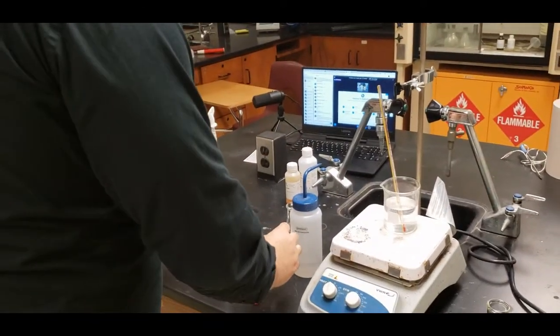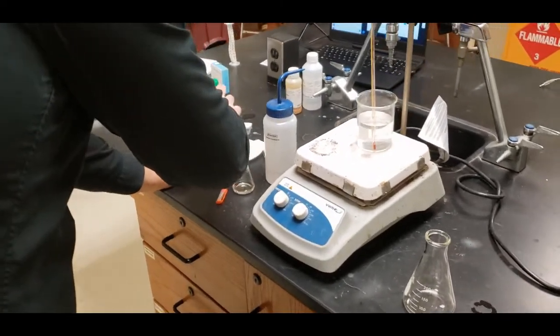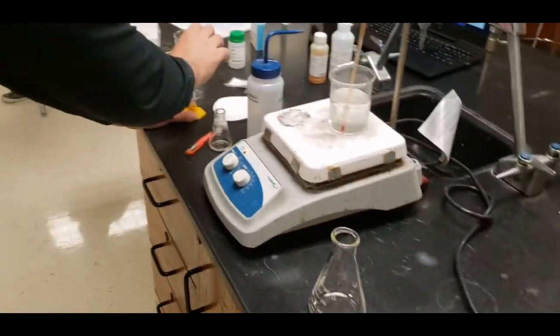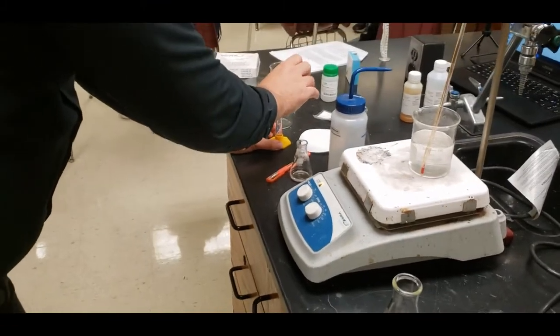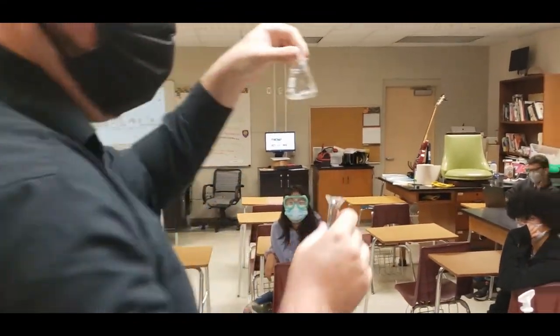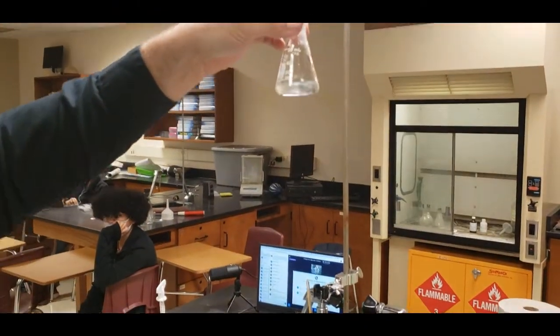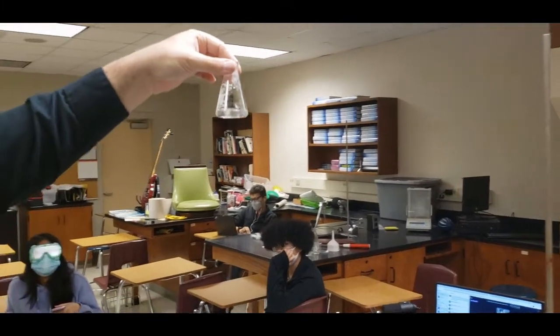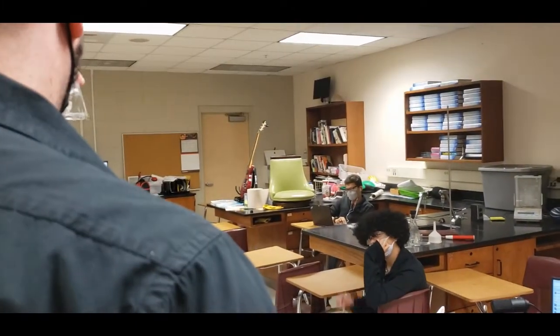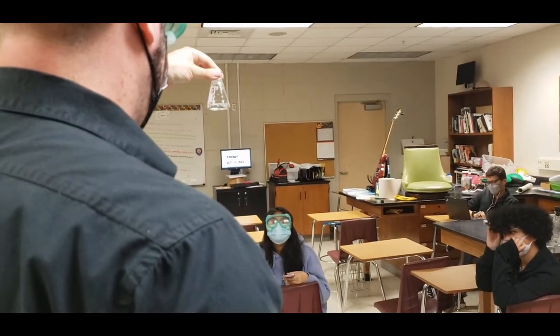The next step is that it wants us to go ahead and add in an entire 5 milliliters all at once. And when I add the 5 milliliters all at once, hopefully you guys will be able to see the reaction a little bit more clearly. Okay. And you guys should see that there's something now in there. It looks funny, right? Not as clear.